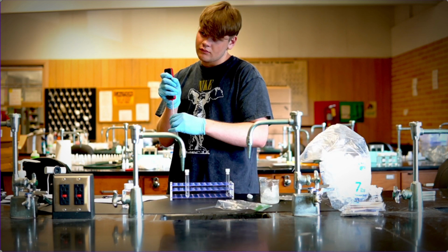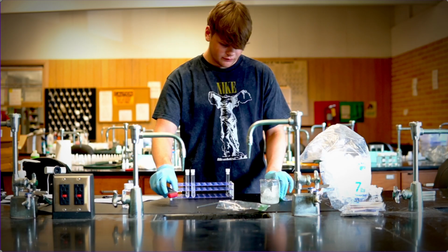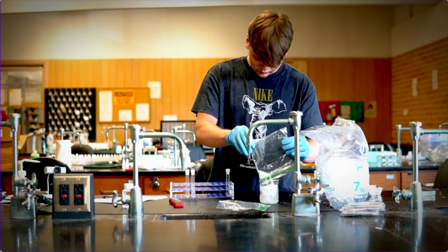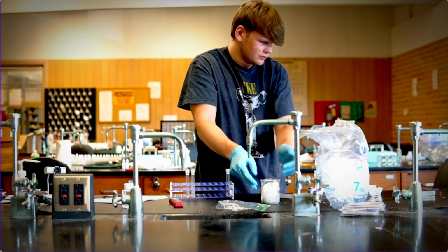And in the third time, guys, very important, do not throw away your ice at this point. You're just going to add to the 30 grams of salt you've already added another bag to make it 60 grams. Right now you have 60 grams of salt, so you have even more salt. So you're going to do the same thing: temperature in 60 grams of salt, temperature before, temperature after, temperature inside the tube over time. Did it freeze, and at what time or temperature?